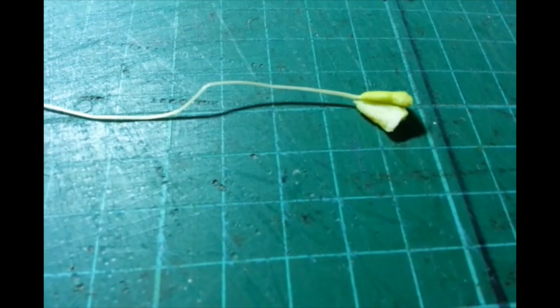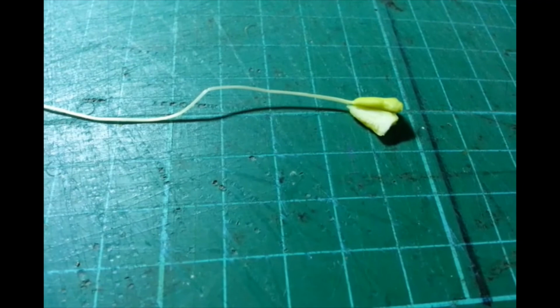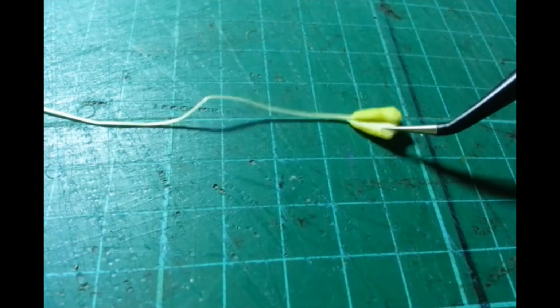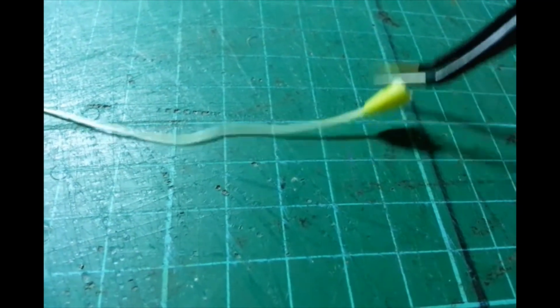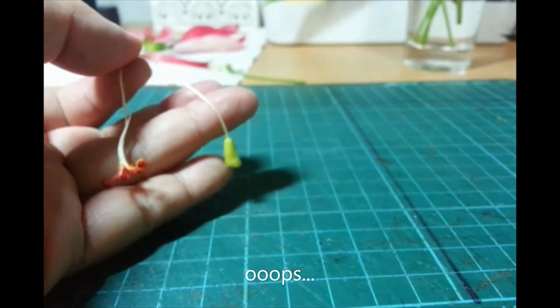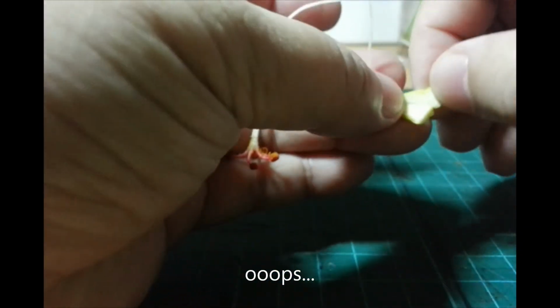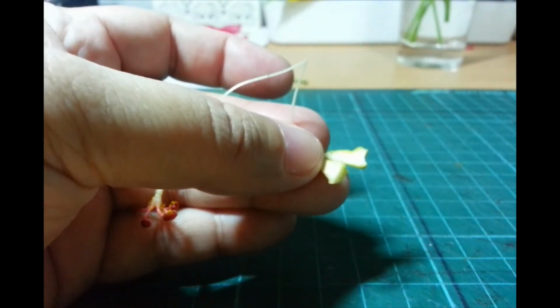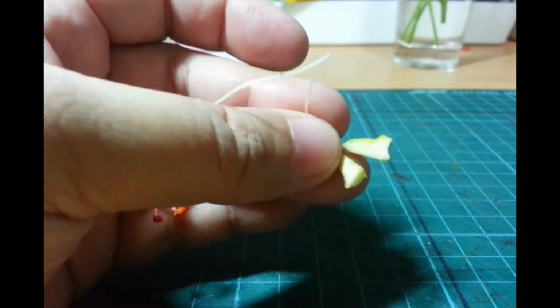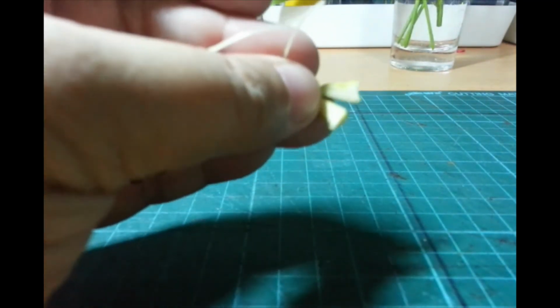Okay. Kita nyo? Magalaw siya. Kita nyo, yan yung maliliit na yan. Oop, dumidikit. Oops! It rolled off. Let's see if I just hold it. That works. Okay. Sorry. Okay. It's easier to see from this side. It's too bright. The light is too bright.